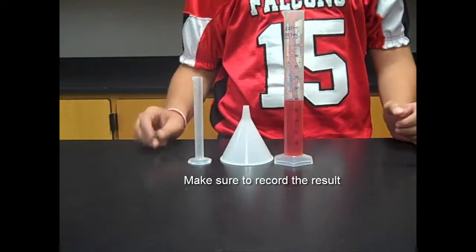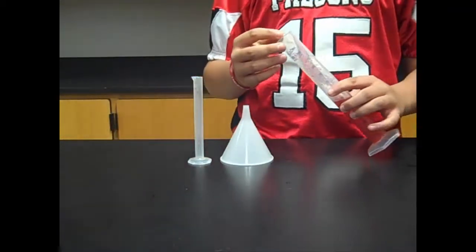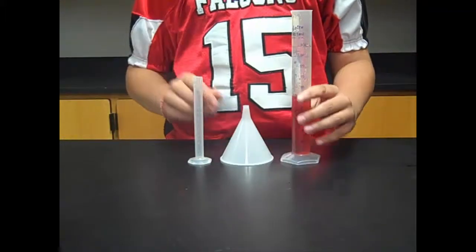After you measure the water, you want to insert the object and do so without splashing the water everywhere.